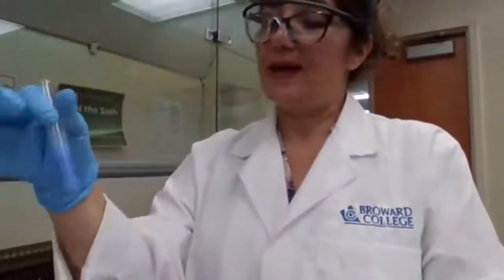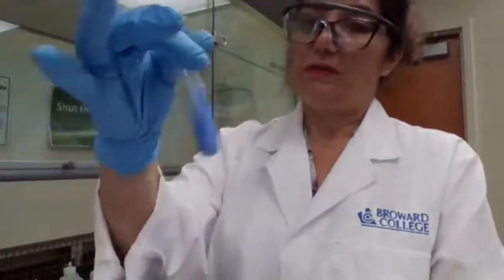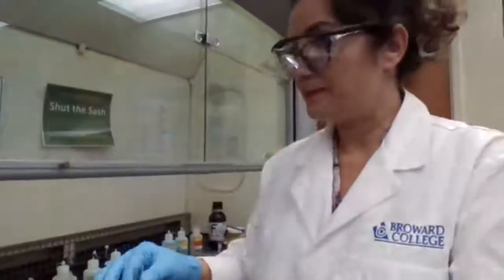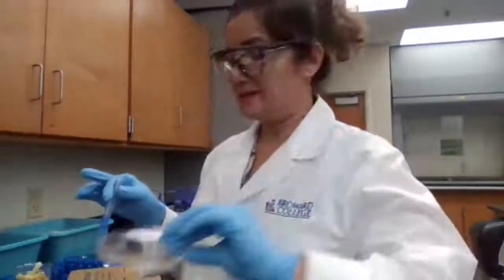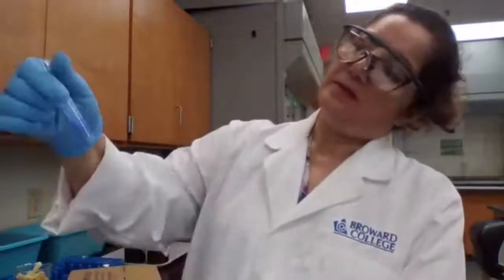We added ammonia until it was basic. We add 3 additional drops of the ammonium hydroxide. The litmus paper that is used, I place it in a watch glass to give like 2 minutes time for this. And then centrifuge it.